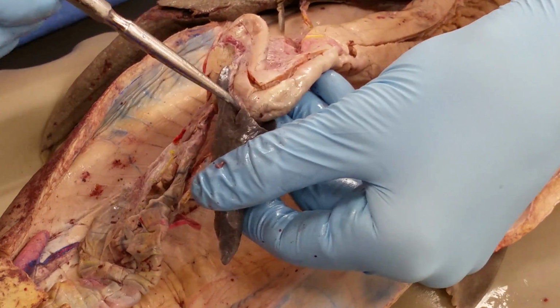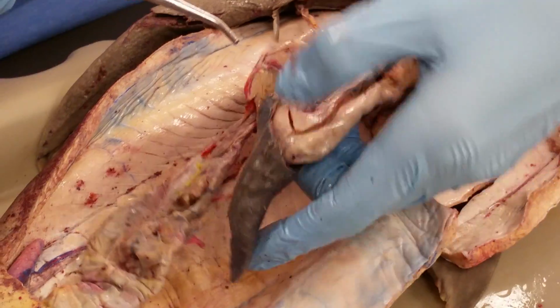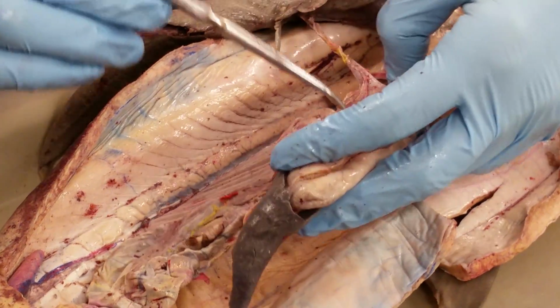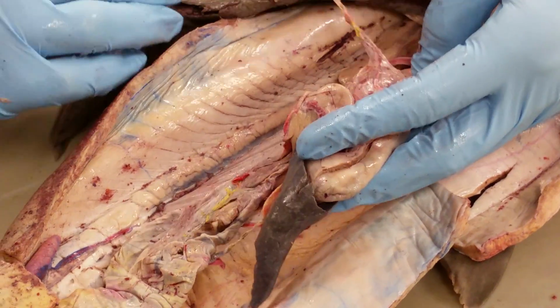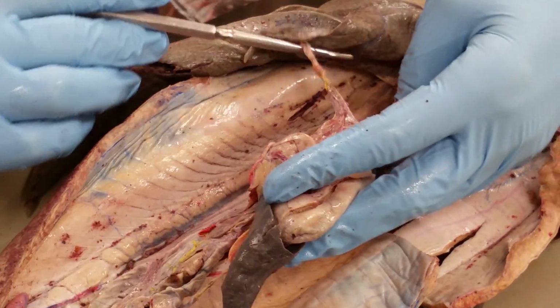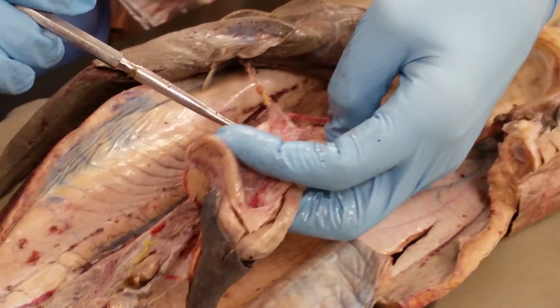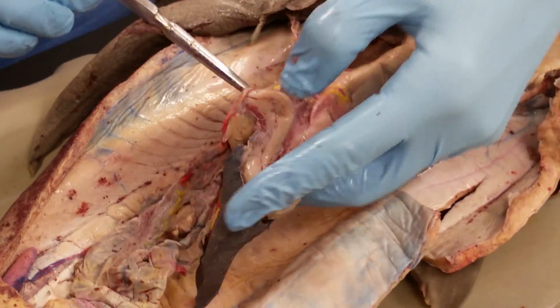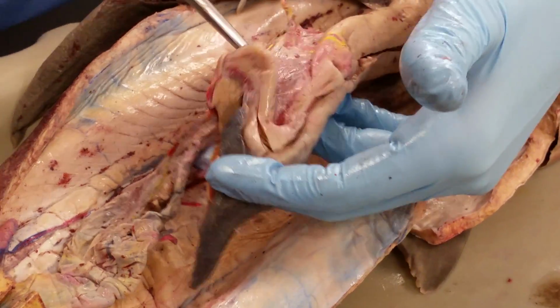You have a gastrosplenic ligament here between the spleen and the greater curvature of the stomach. And you have a lesser omentum here, actually surrounds this bile duct and hepatic artery and vein here, and then it goes over here to the lesser curvature of the stomach and the duodenum. And just like in the cats, there are 2 sheets of the lesser omentum.